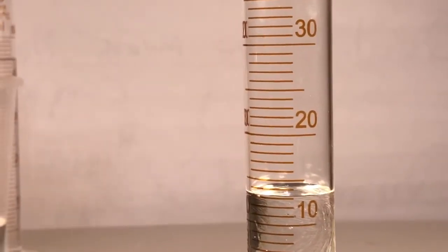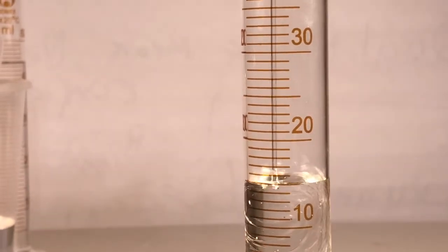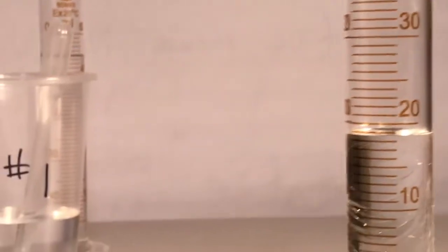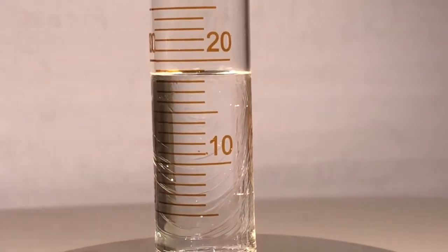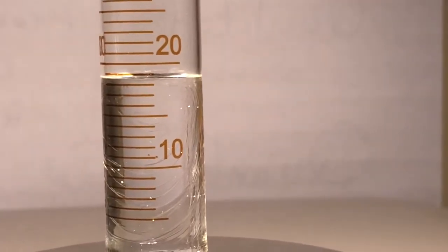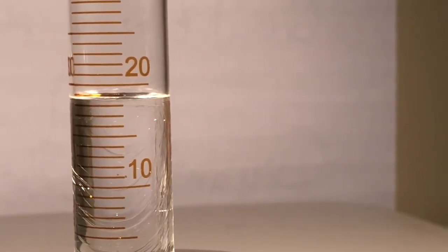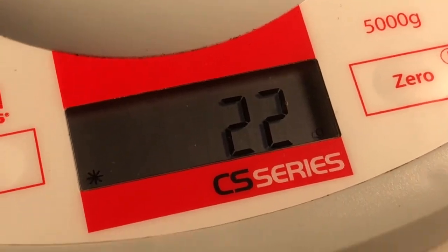Here comes number 4. What's that? You read it. Ooh, that one you've got to read. You've got to be smart. Bigger than 15, less than 20. Wonder what that is. You call it. And that mass is kablamski.